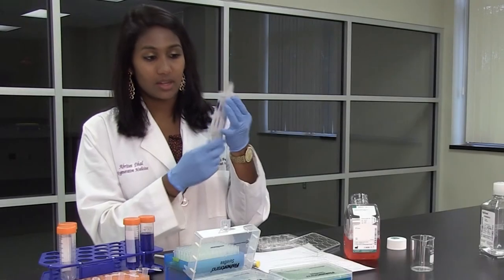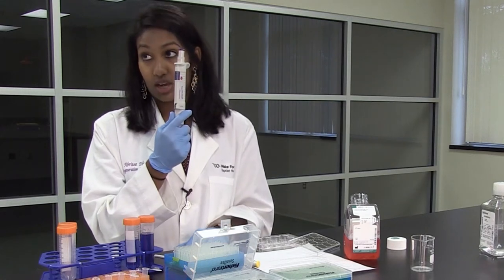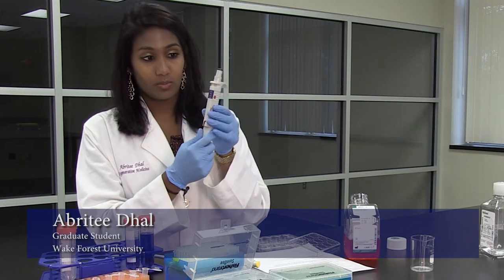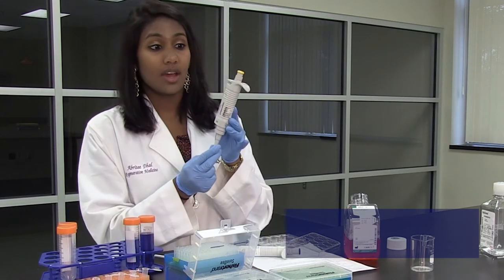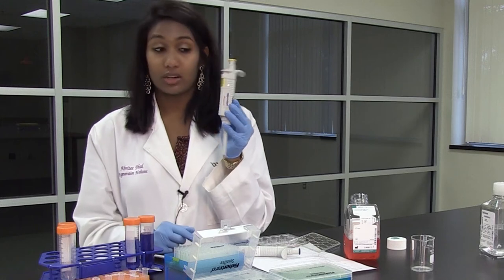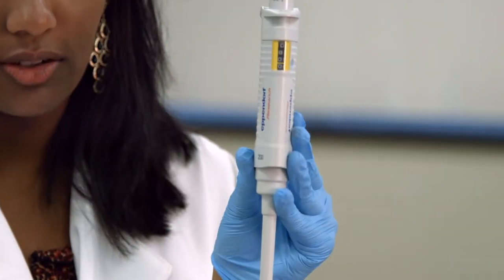On the P1000, this is what 800 microliters looks like. On the P200, if we want to do 80 microliters, this is what 80 microliters looks like.